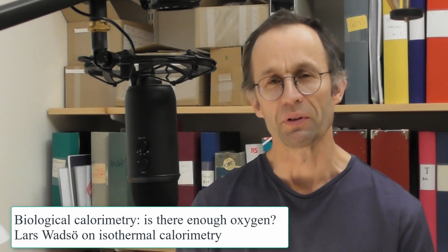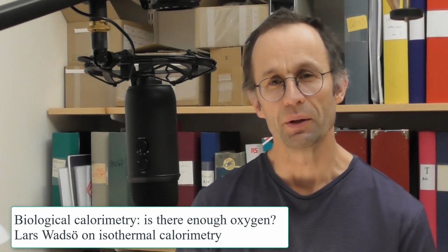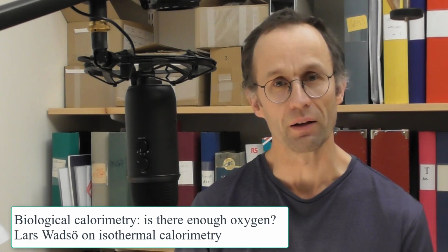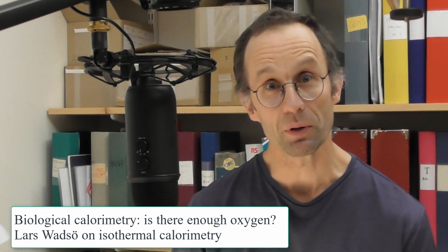When we make measurements with isothermal calorimetry on biological samples that need oxygen, we need to make sure that we have enough oxygen in the vial and not too high concentration of carbon dioxide. Let me show you an example.